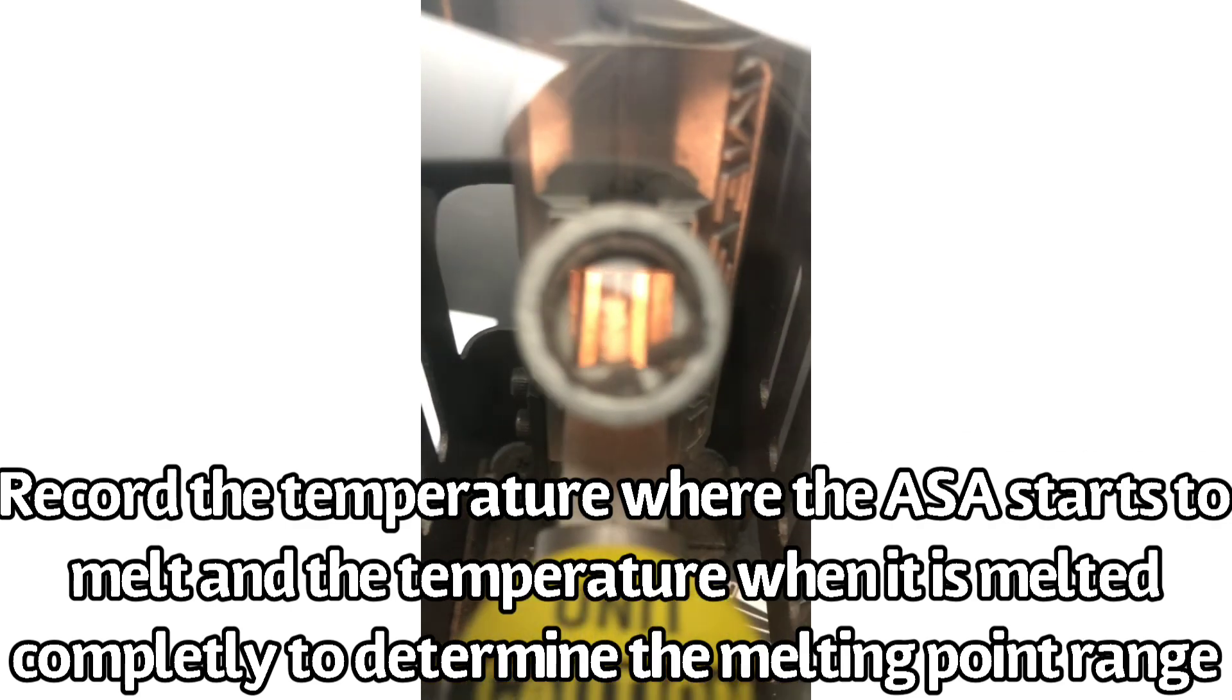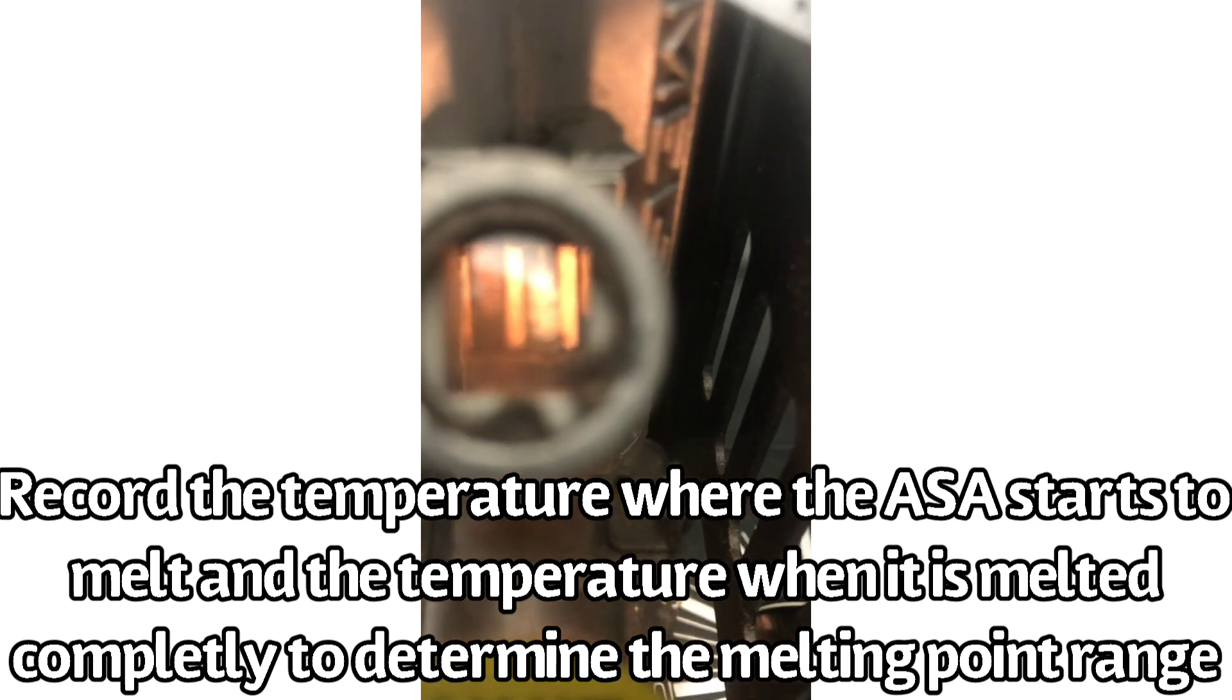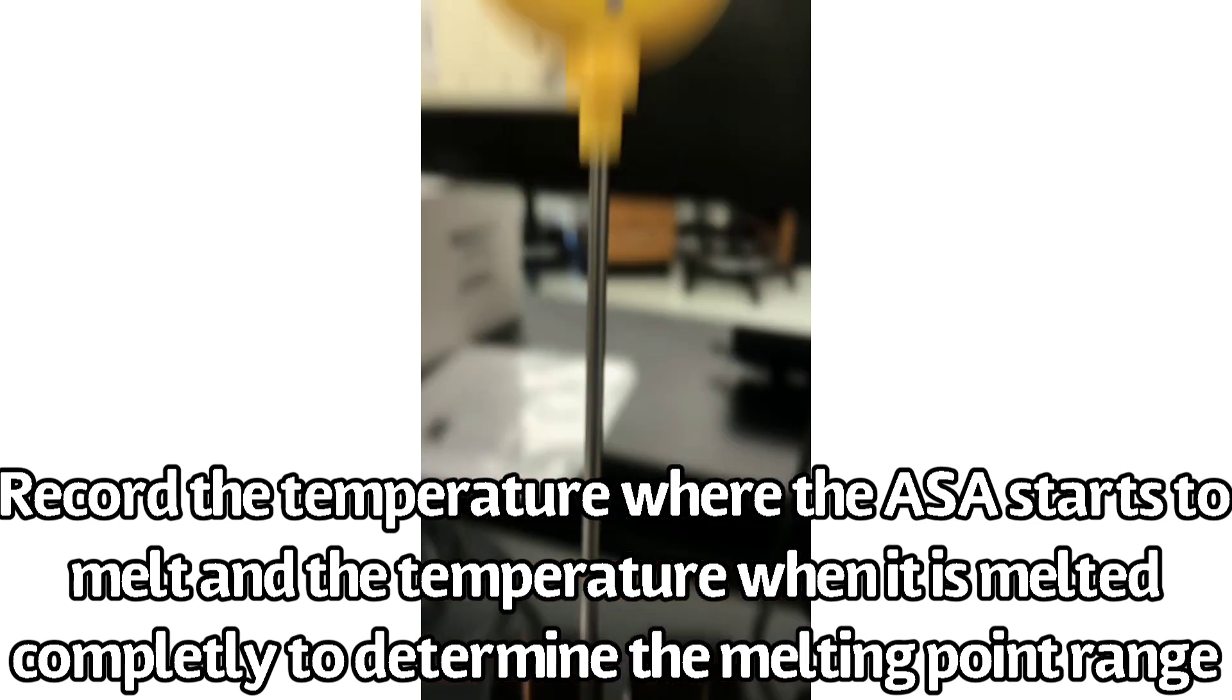Record the temperature where the sample starts to melt and where it melts completely to determine the melting point range.